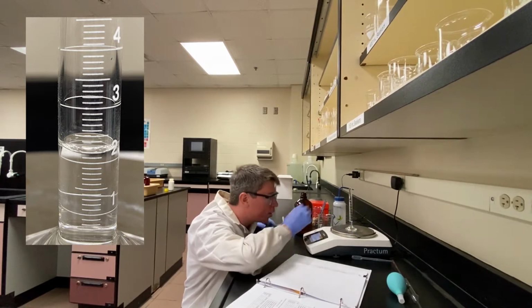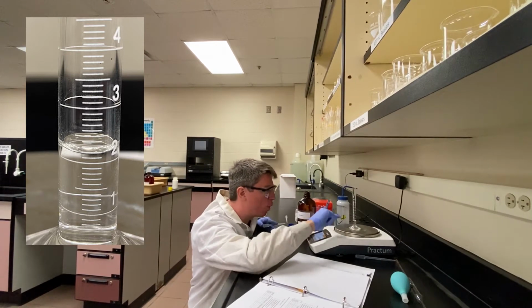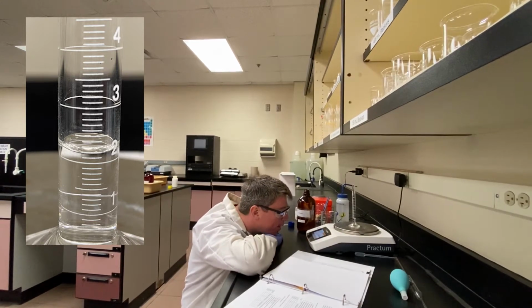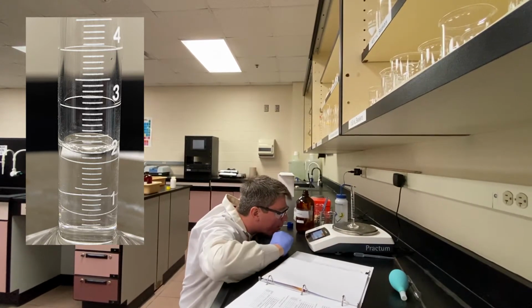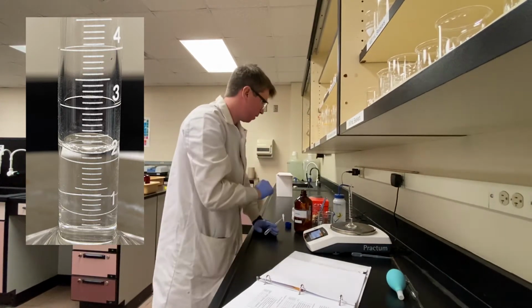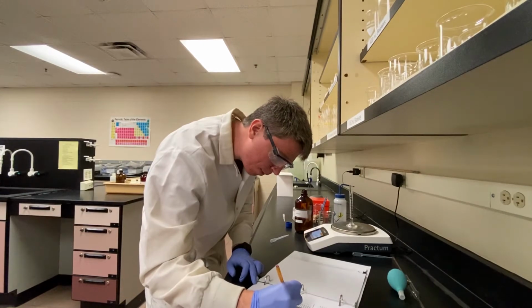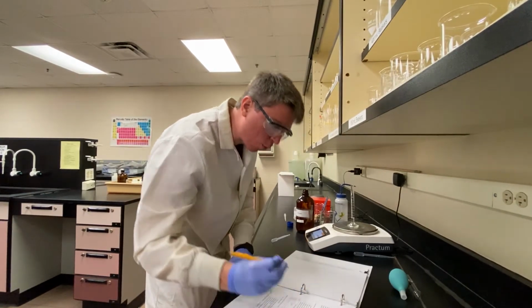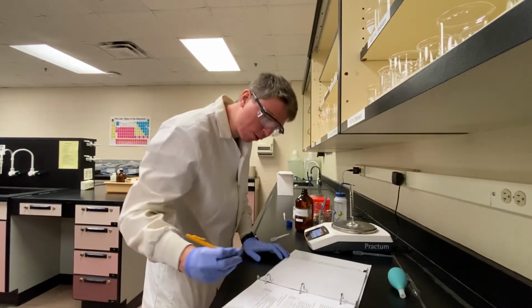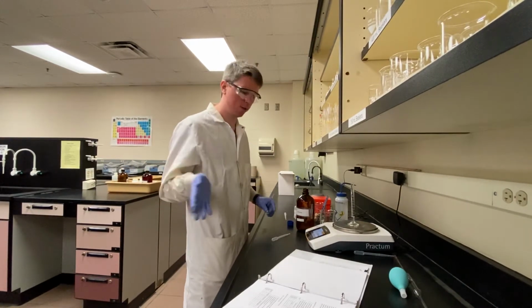So again, just like with the glassware lab, we need to look at our increments, measure between our increments. So this one, each increment is 0.1 milliliters, meaning we'll be estimating that second decimal place. And this one looks like it's right on the line, just above the 2 milliliter mark. So we'll call that 2.1. But again, to 2 decimal places, that would be 2.10 milliliters. And our mass is 1.60 grams. Again, I'll go through all of the calculations for density, average density, and all of that stuff at the end.